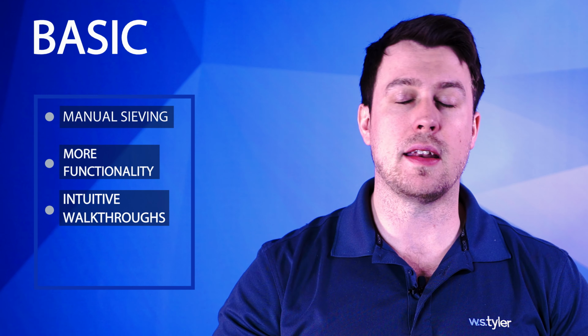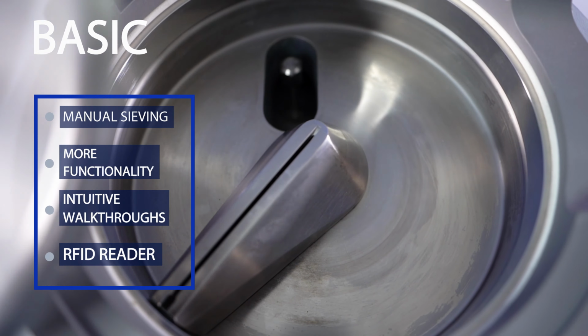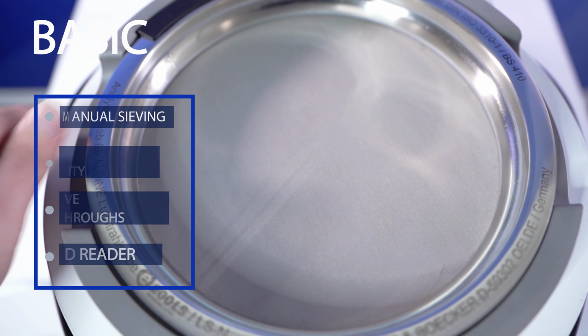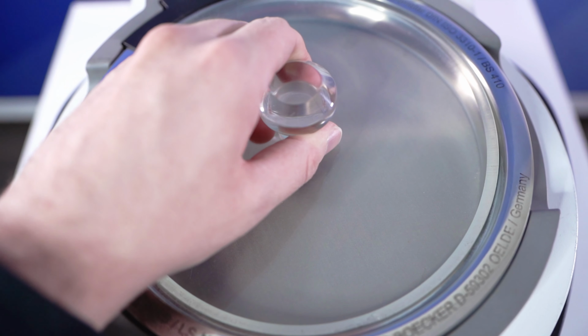Also, what aids in that is the RFID sieves. Now, the E200LS has an RFID reader, and the sieves are unique because they're RFID tagged. What that means is if your operator has, let's go with 100 mesh sieve again, and they need to use that for the test, but they take their 150 mesh RFID sieve and put it in the instrument, it's going to flag it and not allow them to run that test until they put the right sieve there.